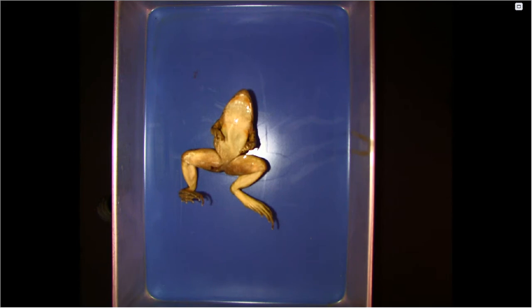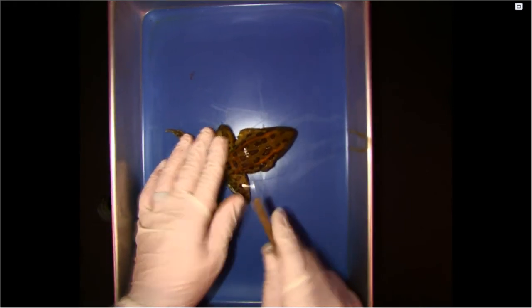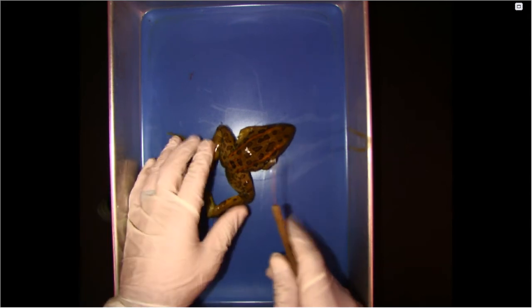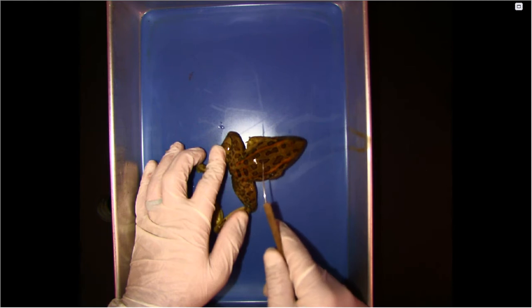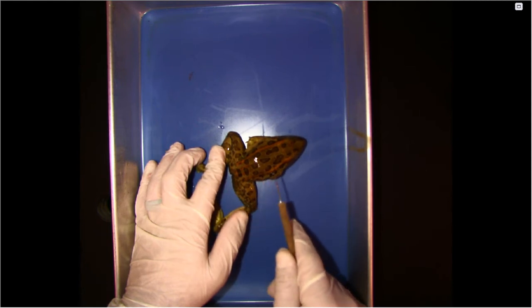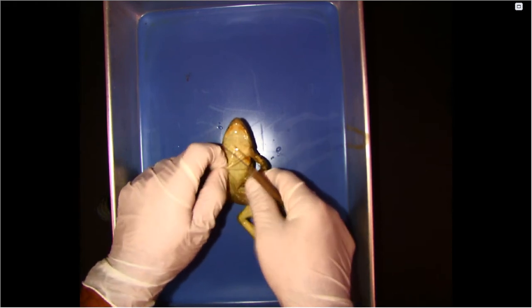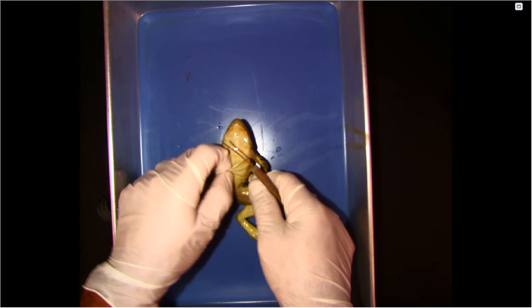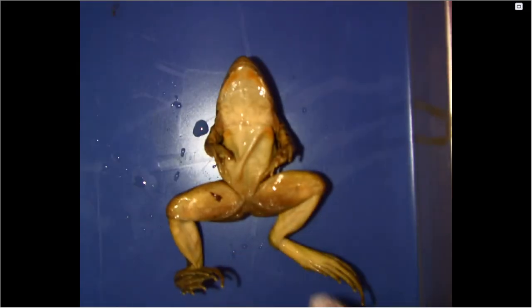Okay. So first, as you can see, the frog's skin is sort of spotted, right? And it's due to the fact that it can camouflage itself. So this is the dorsal side of the frog, and then this is the ventral side of the frog, which is pretty much one solid color, right? But these two are a part of a specific system, right? So you'll have to identify that on your sheet. What system is the dorsal and ventral a part of?